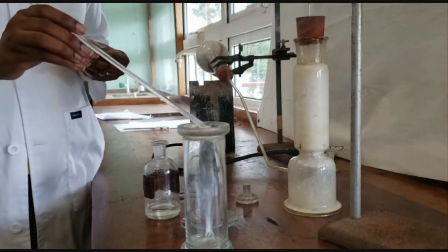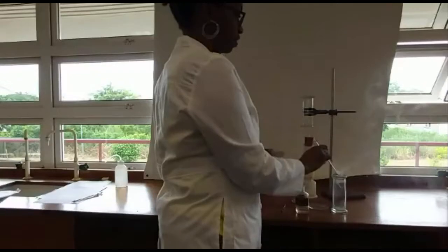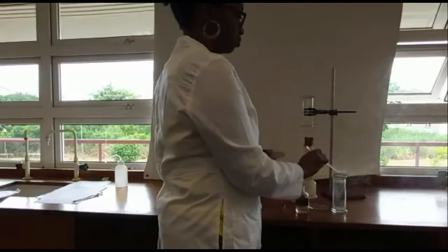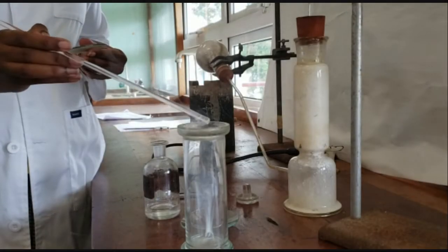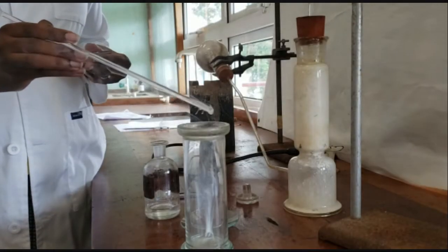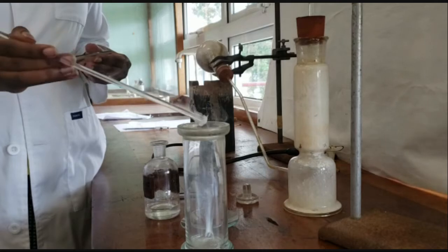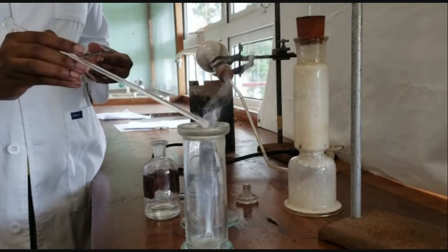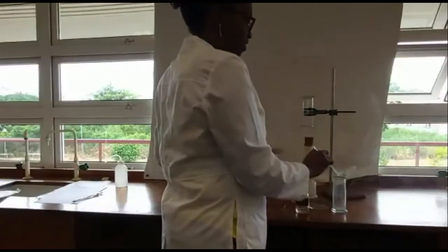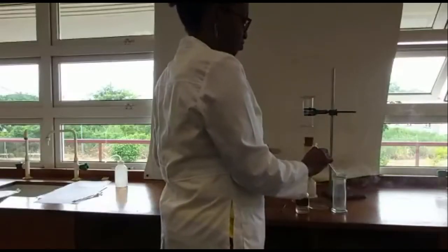Now we're seeing very dense white fumes in the presence of the ammonia gas. Very nice. What is the identity of the dense white fumes?